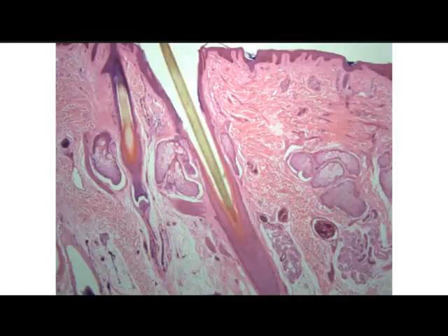So in this slide, it's a very busy slide, but we can see that this has the epithelium of thinner skin. So this is still a keratinized stratified squamous epithelium with the different layers. The only difference between this epithelium and the epithelium of thick skin, such as the palms of the hands and soles of the feet, is that it does not have that stratum lucidum above the stratum granulosum, but all other layers within the epidermis are still represented.